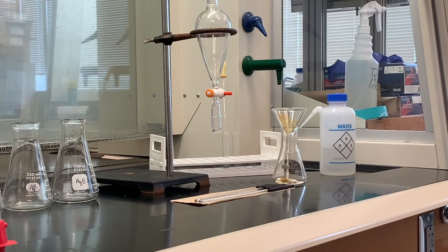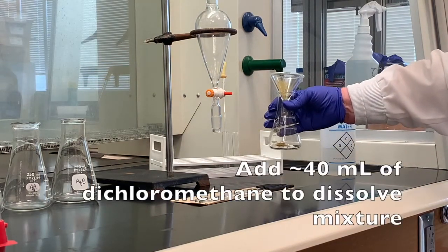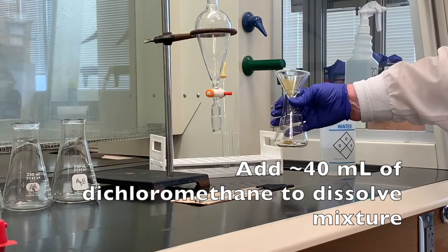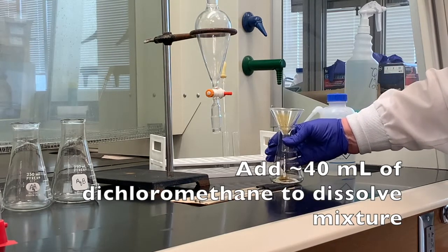So the first thing I have to do is take my mixture of the benzoic acid, p-nitroaniline, and naphthalene, and add around 40 ml of the dichloromethane to that, and then we're going to let that stir until everything dissolves.